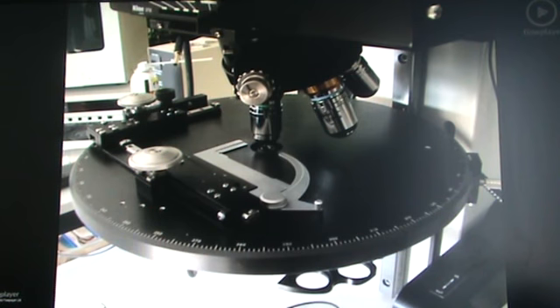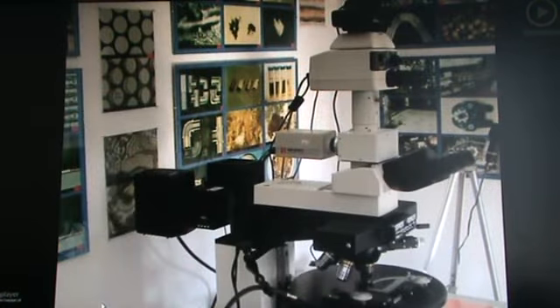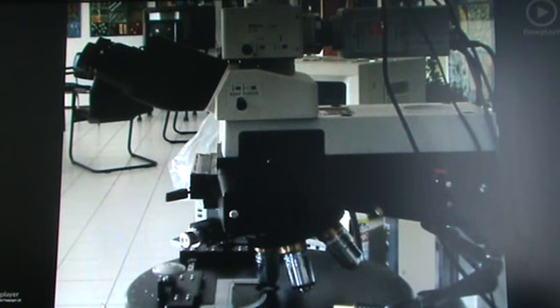This advanced microscope allows you to work with both the conventional methods like bright field, dark field, etc., and then simply change over to any of the new methods quickly and easily. This new technology makes it possible for you to view living biological structures at a greater magnification, resolution and depth of field than was previously thought possible.